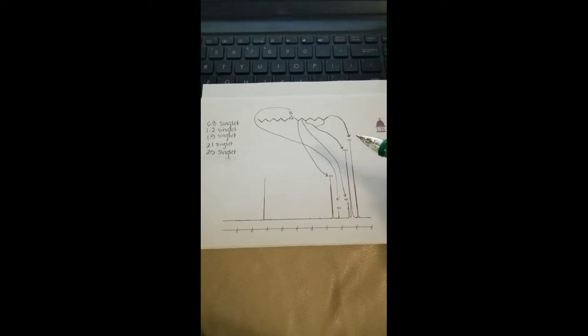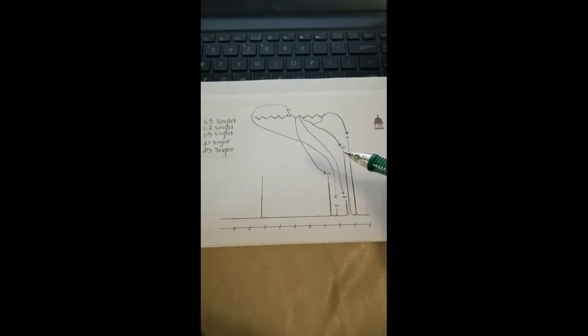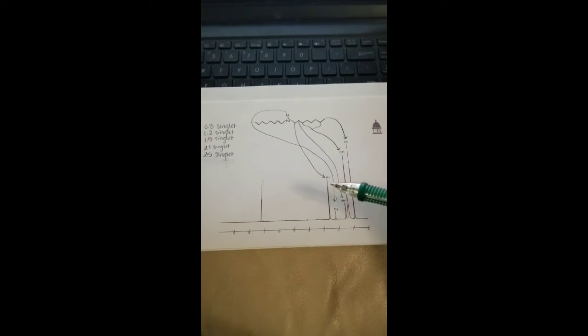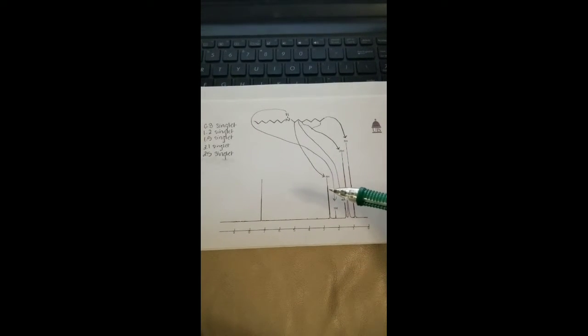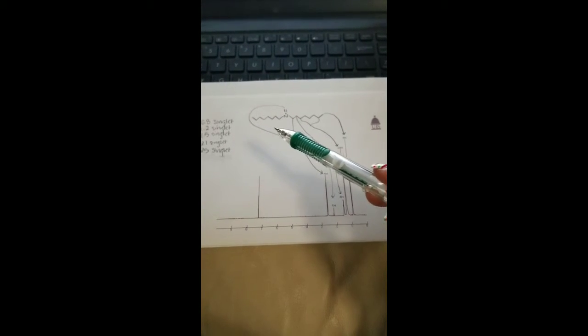I really like this chart because it shows how many hydrogens we can expect to see at each point. So this first one has 6, and 20, and 4, and 1, and 4. Based on this, as well as the mass spec and the IR graphs, I've come up with this structure.